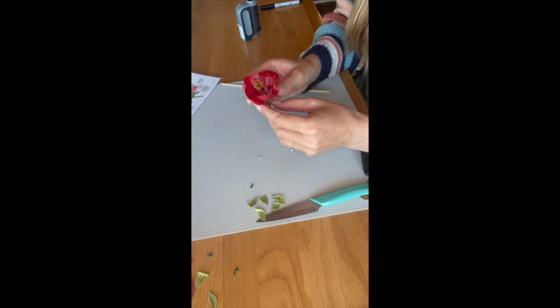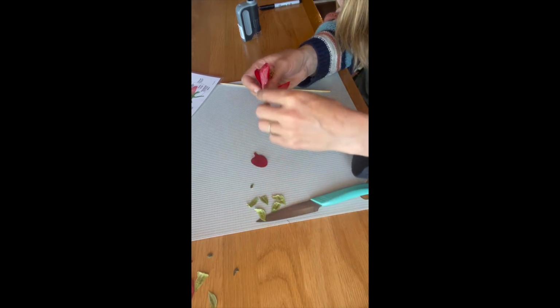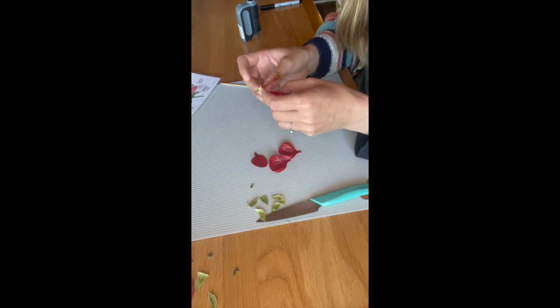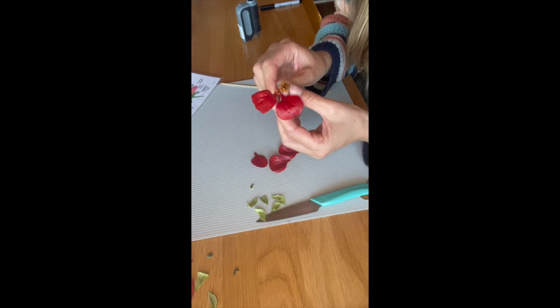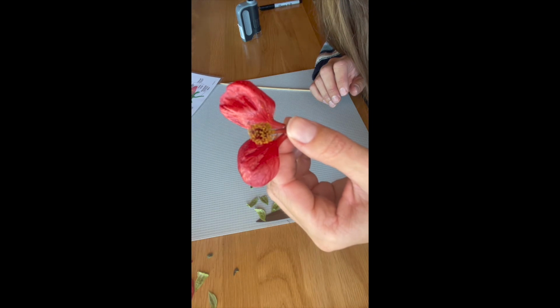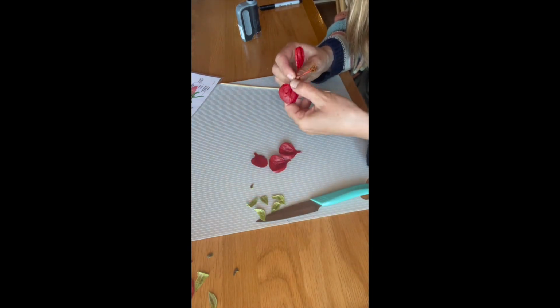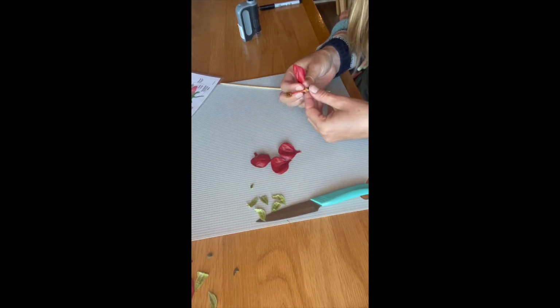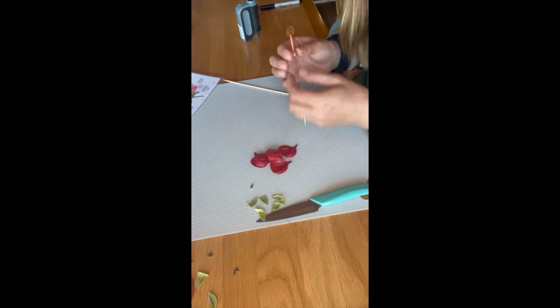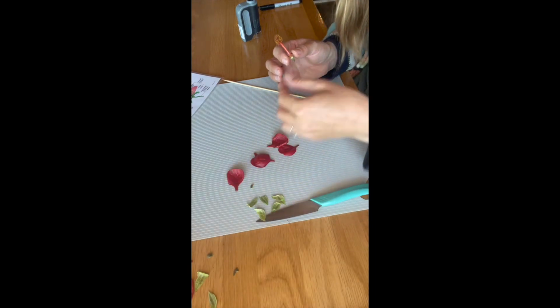We're going to do the same thing with the petals. We're going to take those off too. We're going to count them as we go. 1, 2, 3. Look at the pollen getting everywhere. I don't know if you can see that. Lots of pollen on this flower. Oops, 4 and 5. We have 5 petals, and they're beautiful. Look at the veins in those petals, really pretty.